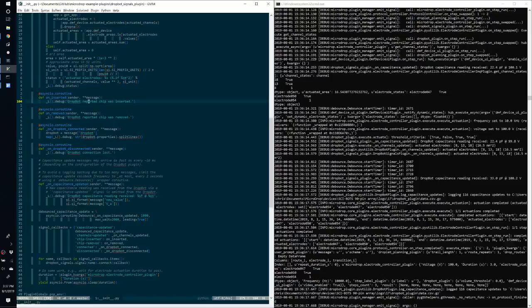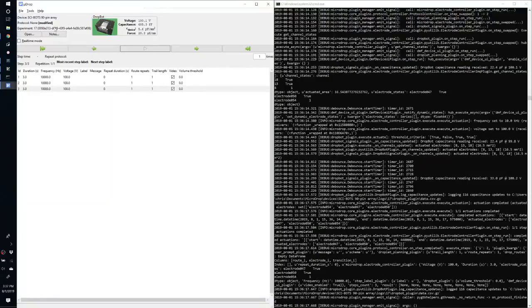So if you were, for example, using a pump to fill up a reservoir, you could monitor the capacitance values and then change the actuated channels once the capacitance has reached a certain value, and continue the protocol after that. So this should provide a way to connect to the DropBot signals as required.